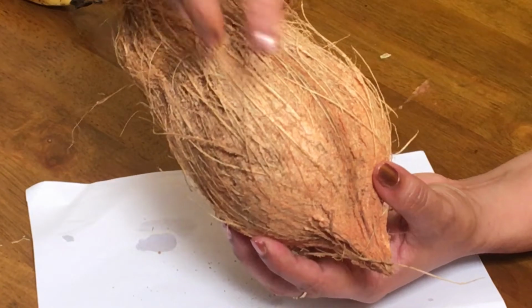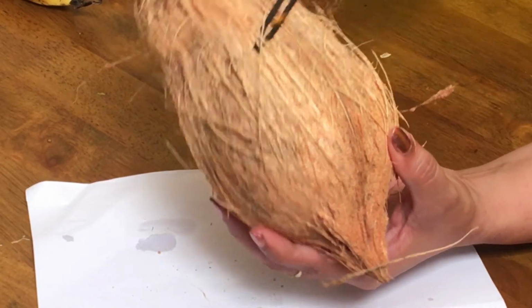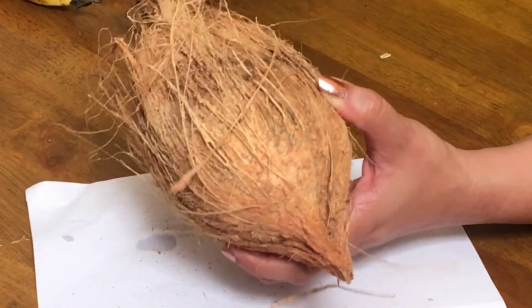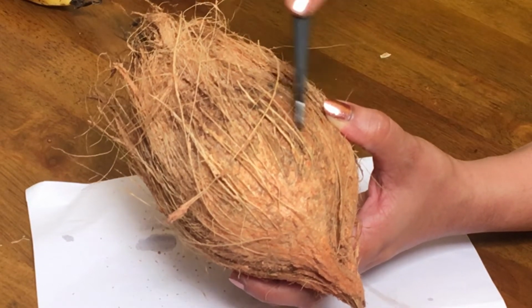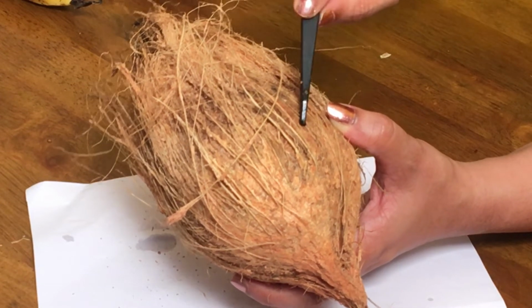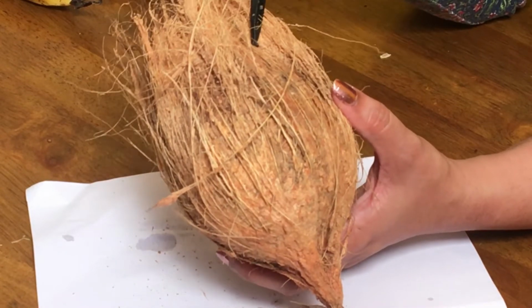This fibrous part which you can see, these are all the sclerenchyma fibers which make up the mesocarp of the fruit. So this fibrous part of this coconut is actually the mesocarp. And which one is endocarp? Endocarp is this. You can hear the sound. This is very hard. The endocarp of coconut is very hard and it looks like a stone. So such type of a fruit where the endocarp is very hard and stony is called as a drupe. So this is a drupe fruit.